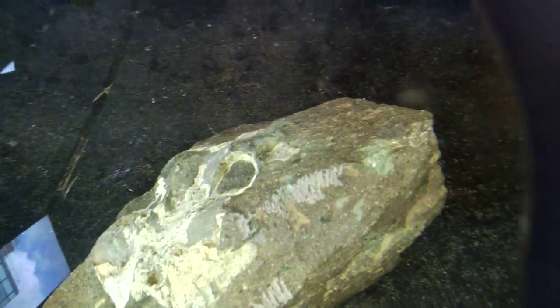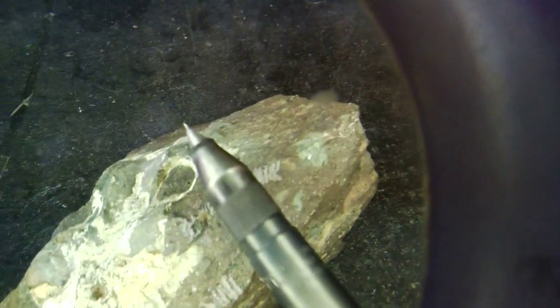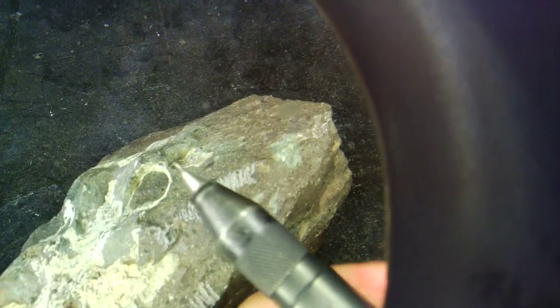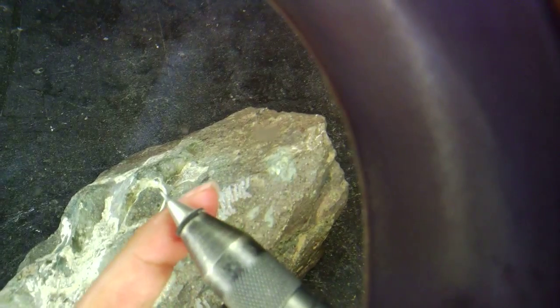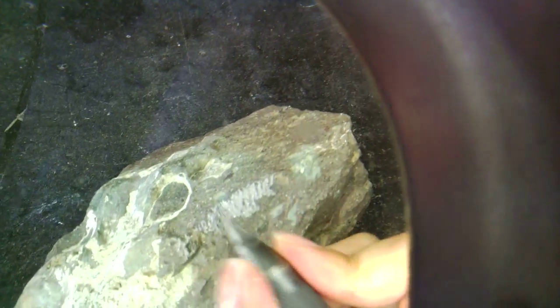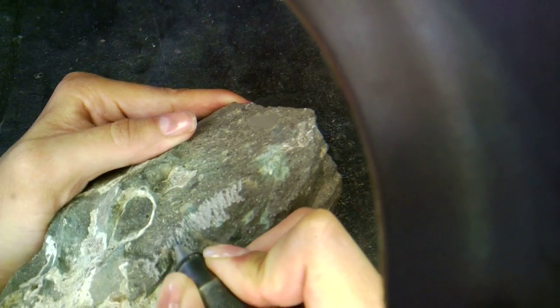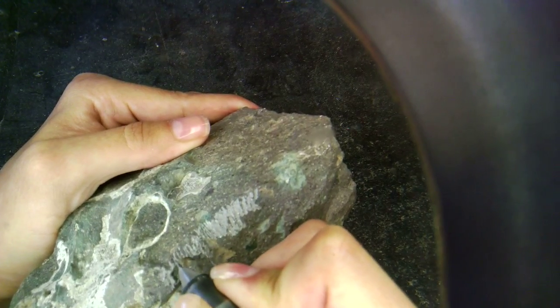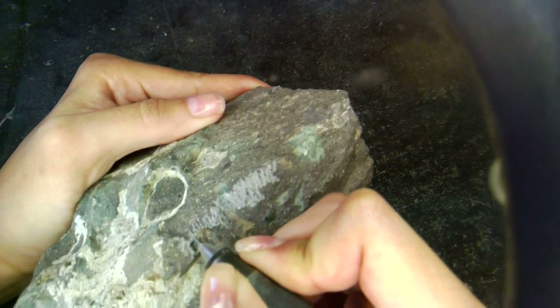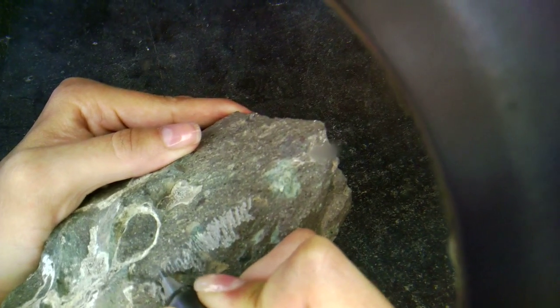I'm going to turn this off. Once I get closer to the specimen, I'll move on to a much finer tool, like this one here. It's another air scribe. Again, it's powered, it's got air running through it, and another type of needle that's a little bit finer and more stable than the one we saw before. And because it's more delicate, it's going to be removing a lot less matrix than the tool I used previously. However, I can get a lot closer to the specimen without risking damage.